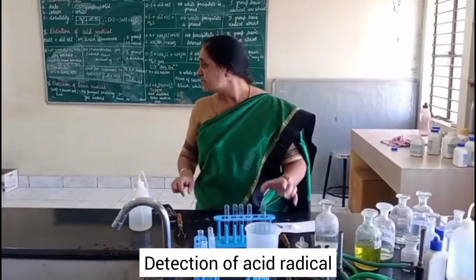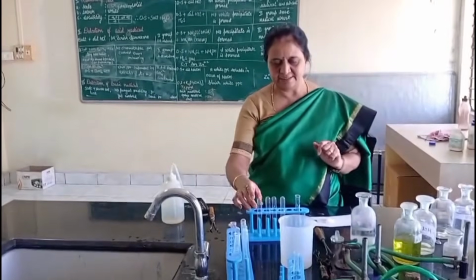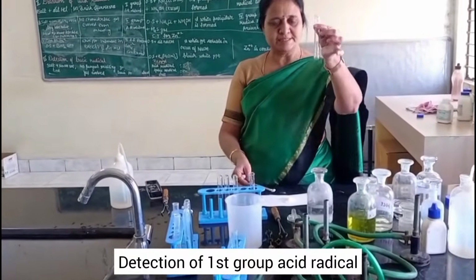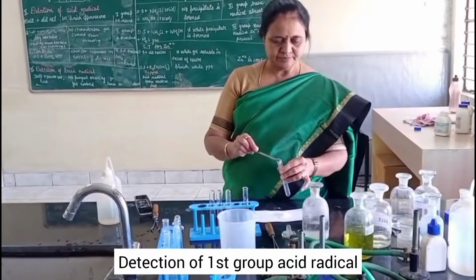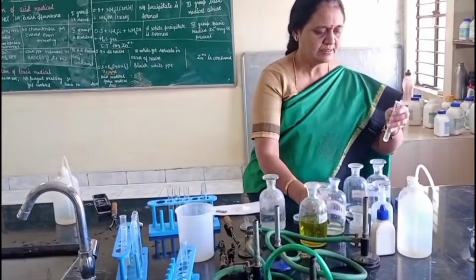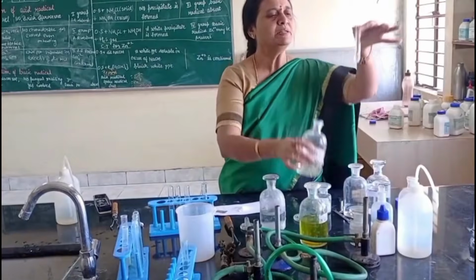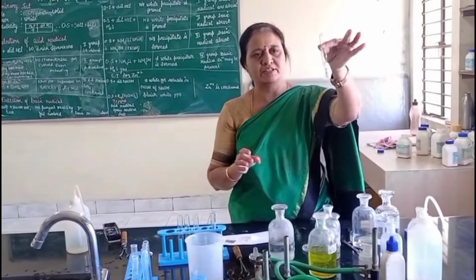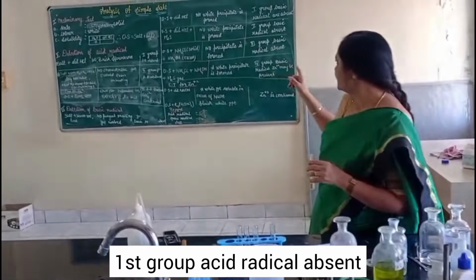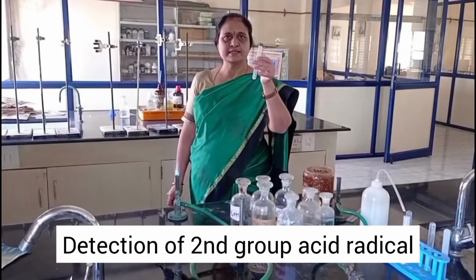Now I move to second step of the experiment, detection of acid radical. For detection of first group acid radical, I take salt and add dilute HCl. Salt plus dilute HCl. No brisk effervescence or no reaction. So first group acid radical absent. Detection of second group acid radical.